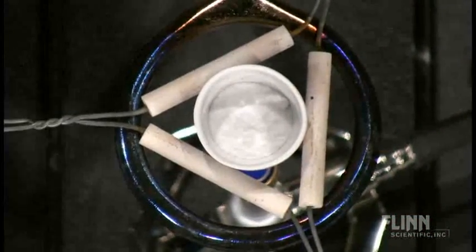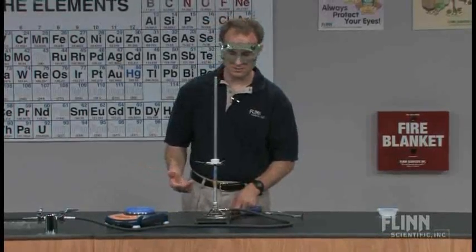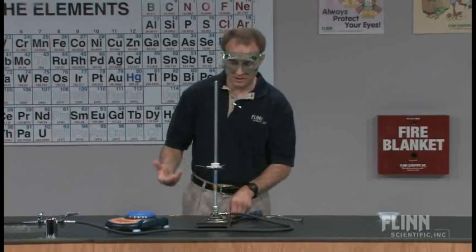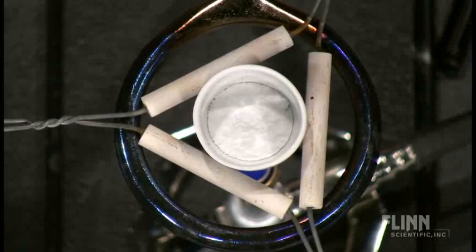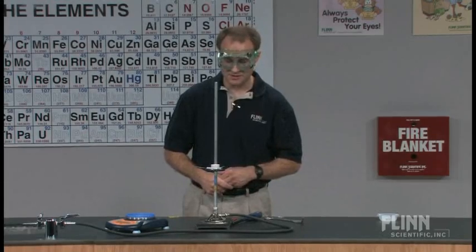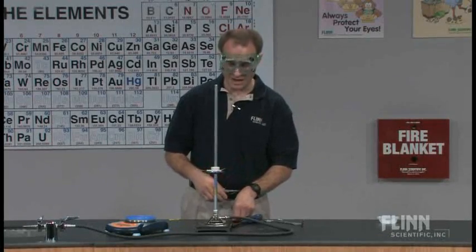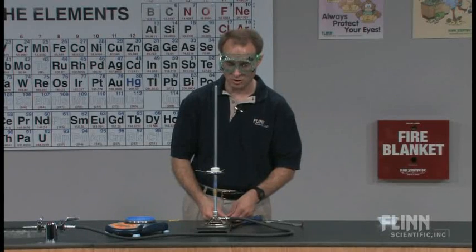The crucible that I'm using is a ceramic crucible — you could also use a metal crucible if you have that. I also like the fact that you do not need to use a lid on the crucible. In fact, you get better results without one, because what we want is the first reaction to take place where the sodium bicarbonate decomposes to form the sodium carbonate. Higher temperatures can cause other side reactions to occur.